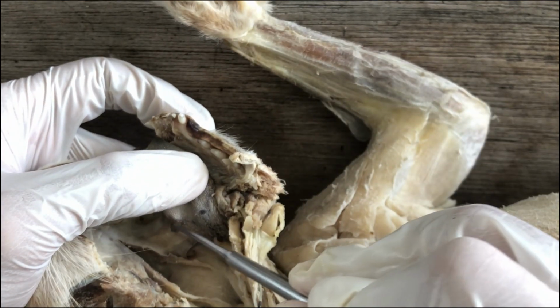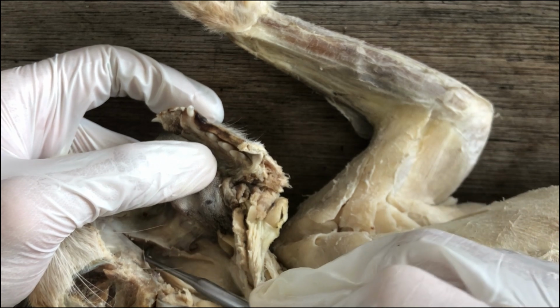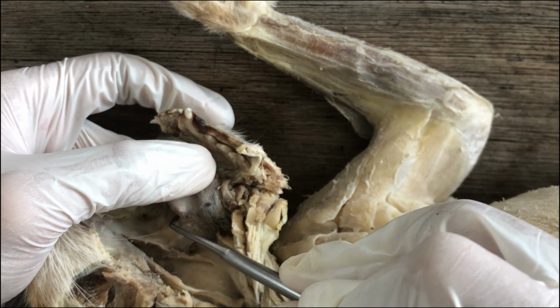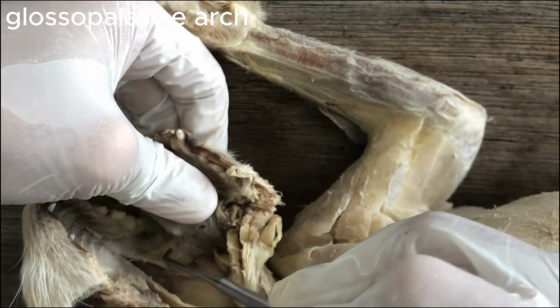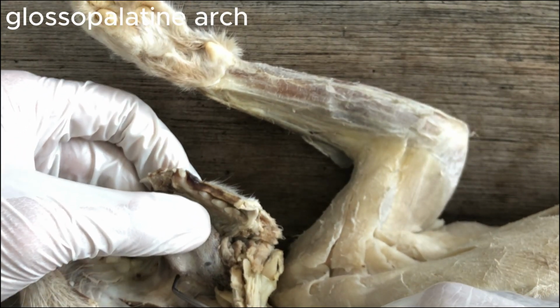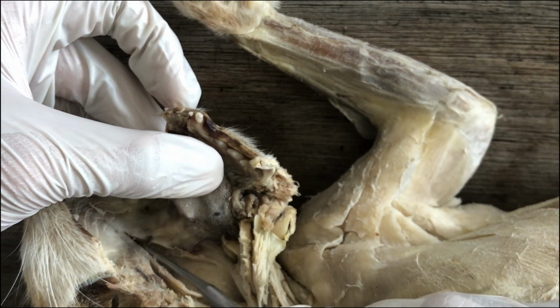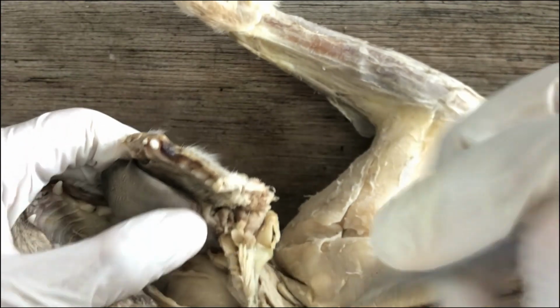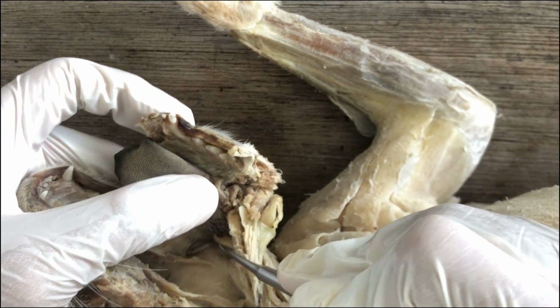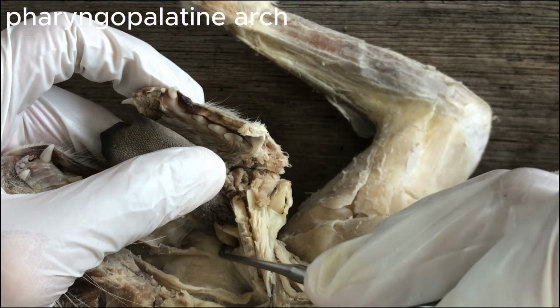And the arch anterior to the palatine tonsil is the glossopalatine arch. It's named so because it's connected to the base of the tongue and to the palate, glossopalatine arch. And then the arch posterior to the tonsil is the pharyngopalatine arch.